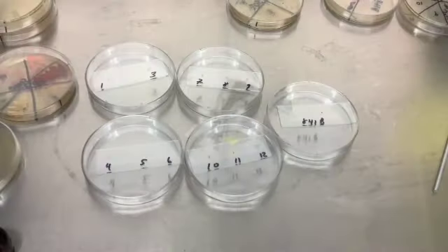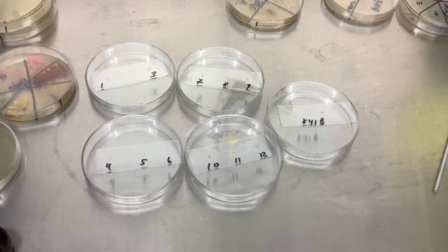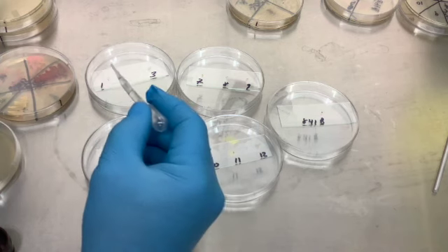Okay, we're gonna finish up the catalase. So I'm going to put hydrogen peroxide. What you're seeing is I have the cells on the slides. You can't hardly see a spot. You can see a little bit on this one, but it doesn't take much. You just have to have a little speck of it. Alright, so we're going to go along and put drops of peroxide, and then you're going to look for them to fizz.